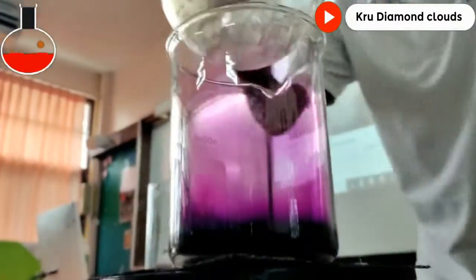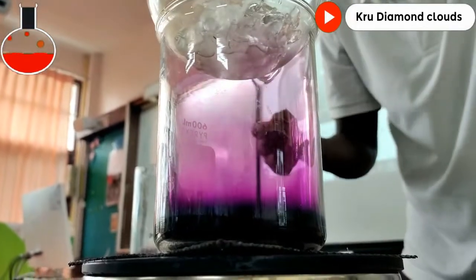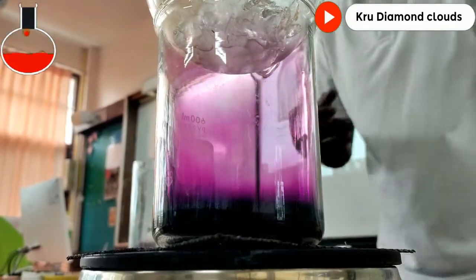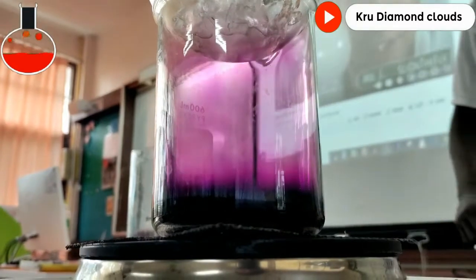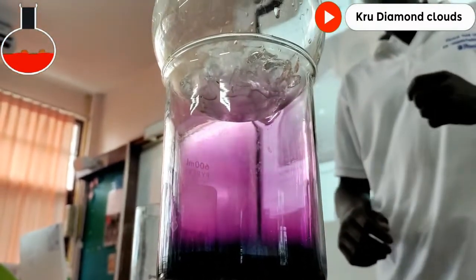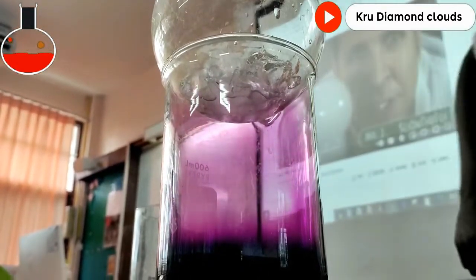Now we put dry ice inside this round bottom flask. So you see, now the gas is going to change into solid crystals. So let's wait for that.